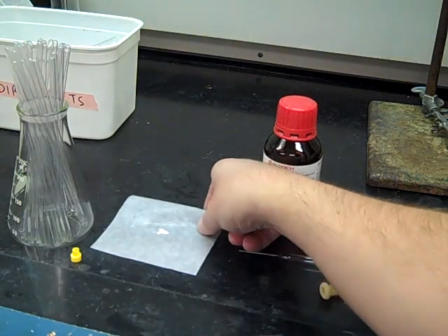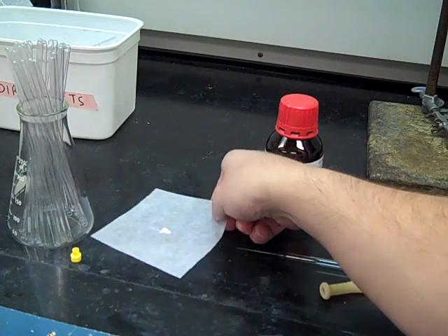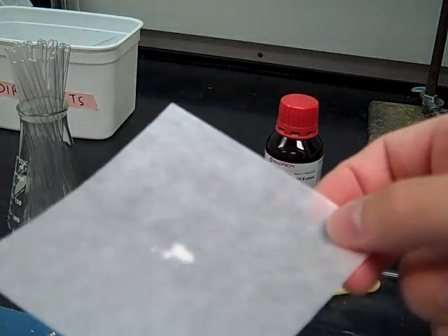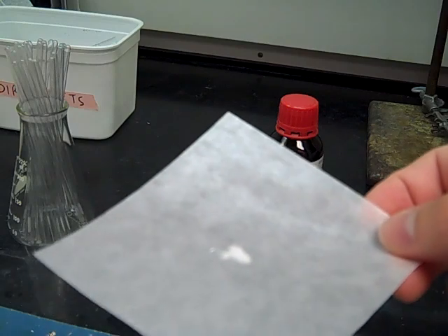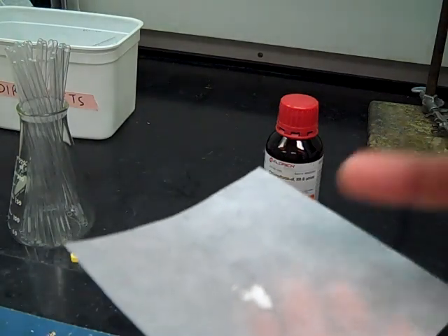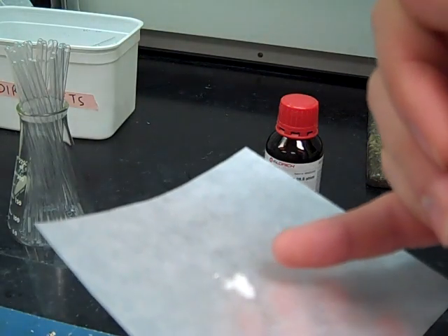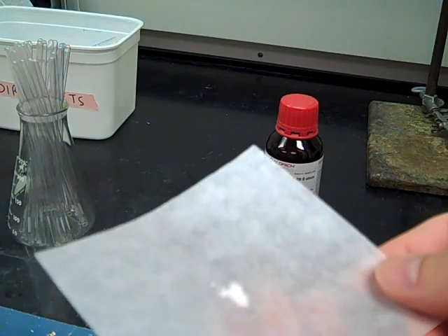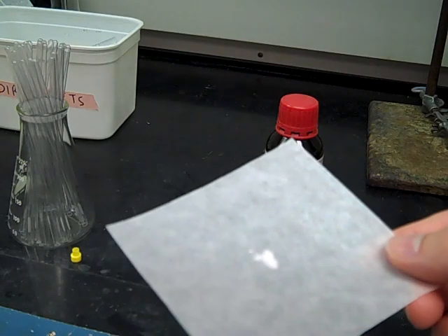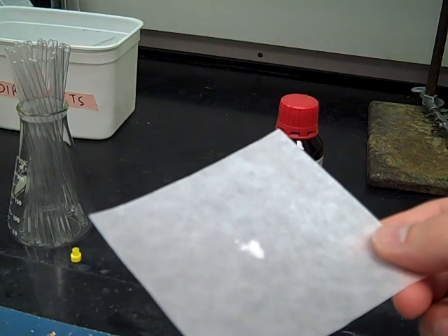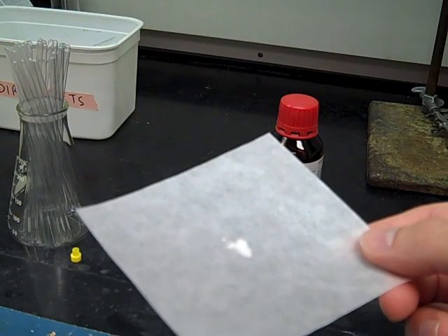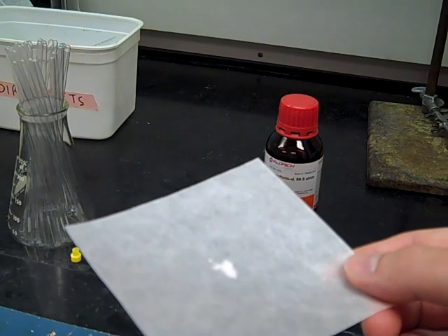So the actual sample, in this case my sample happens to be a solid. And I've already weighed out about 10 to 15 milligrams. So 10 to 15 milligrams is not very much. You can see in relation to my finger it may be kind of the size of the tip of my pinky. So you don't want too much sample inside of this tube or it'll oversaturate your analysis. If you have too little in there you may not get a clean NMR. So make sure you have 10 to 15 milligrams weighed out.